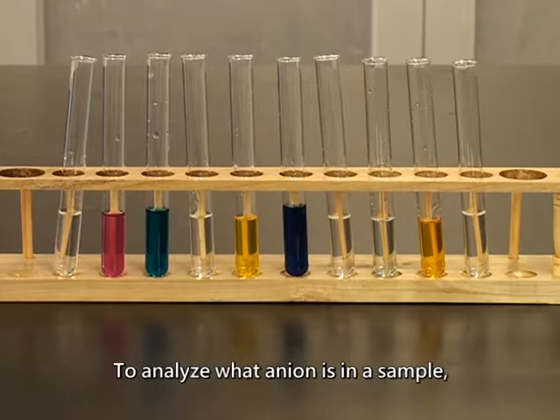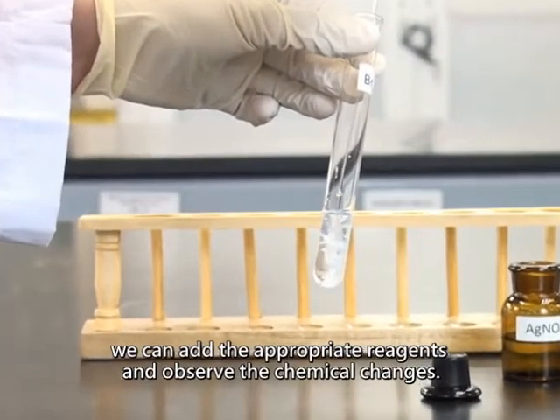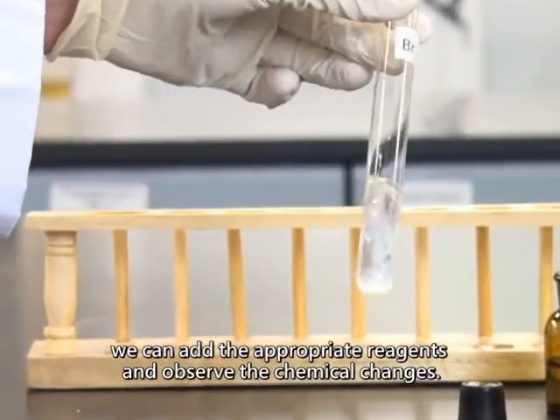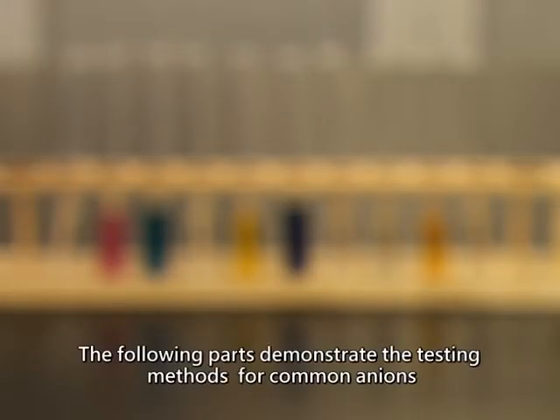To analyze what anion is in the sample, we can add the appropriate reagents and observe the chemical changes. The following parts demonstrate the testing methods for common anions and the expected observations.